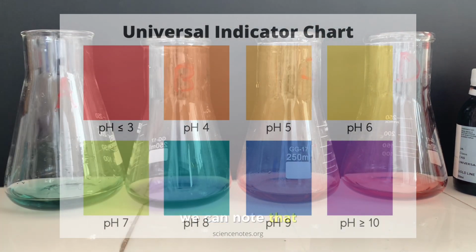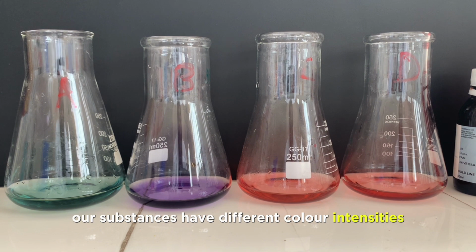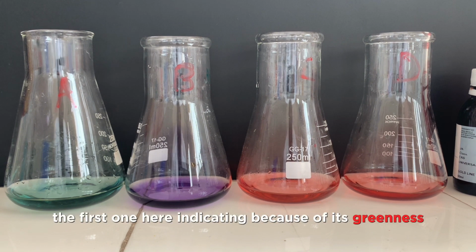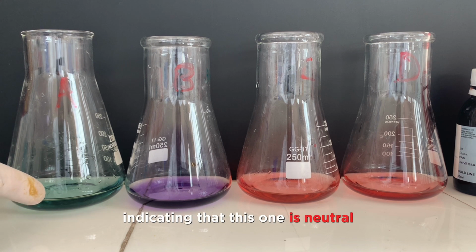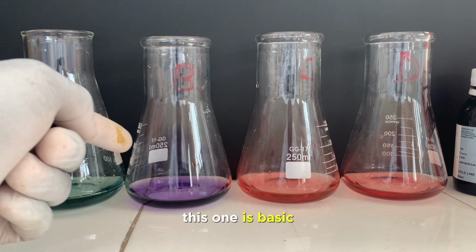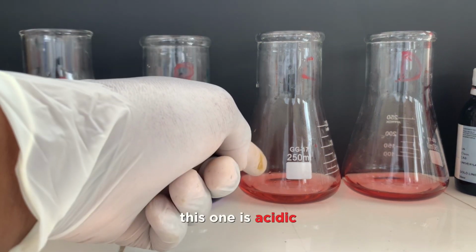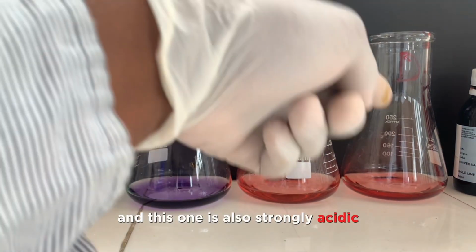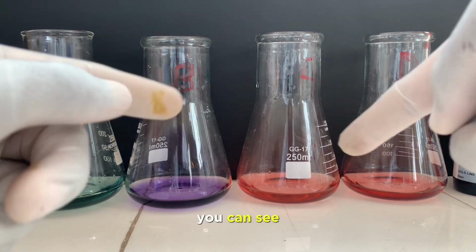Alright, so in this qualitative test, we can note that our substances have different color intensities. The first one here is green, so the greenness indicates that the substance is neutral. The second one is purple, indicating that the substance is basic or alkaline. The third one is acidic because it is red. The fourth one also strongly acidic because it appears red.